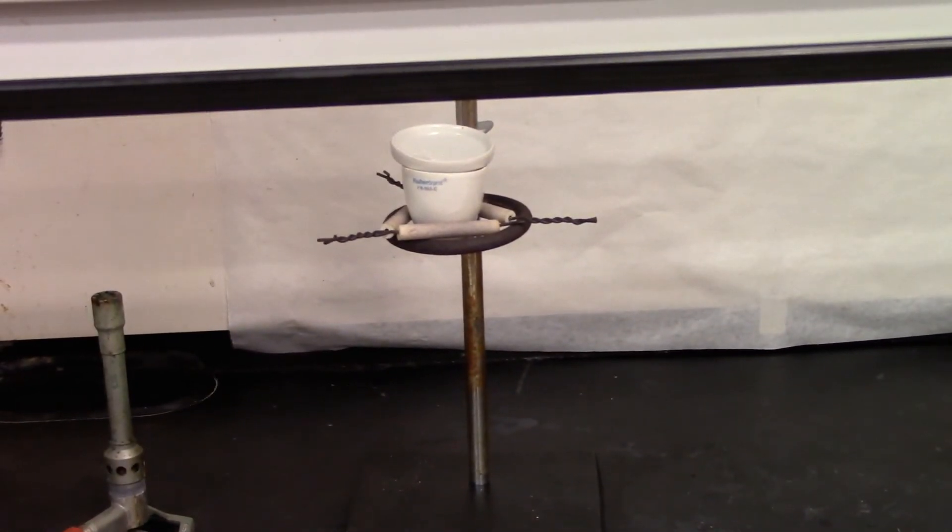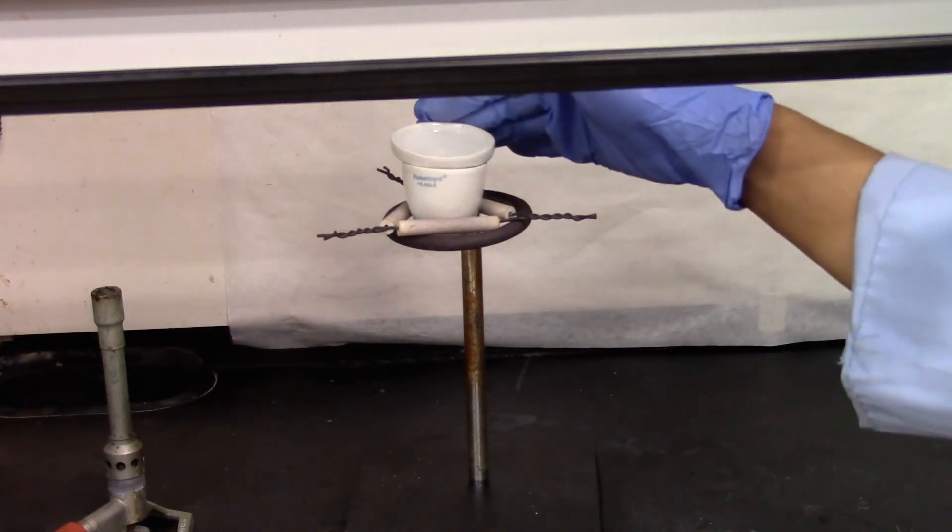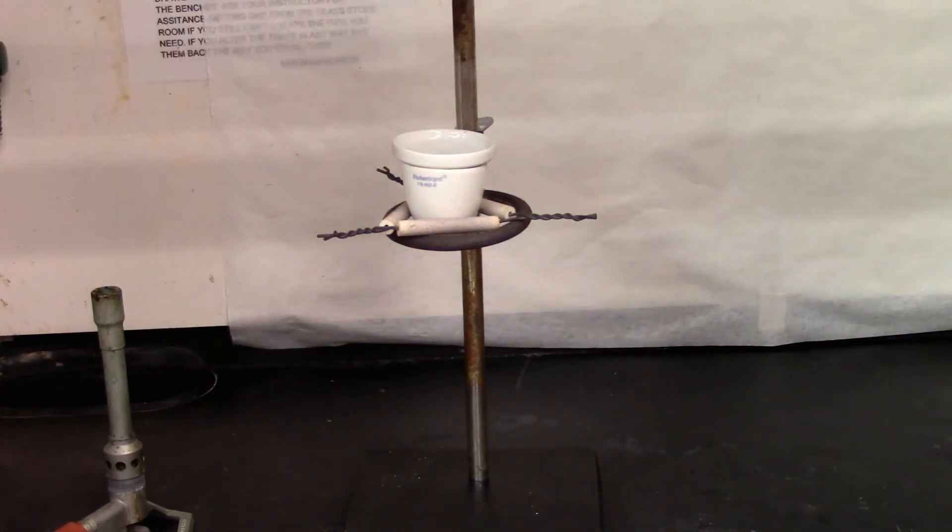So it's been about 15 minutes. The crucible must have been cooled down. Now we are going to go ahead and weigh it in the balance.